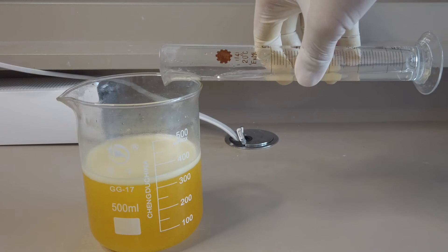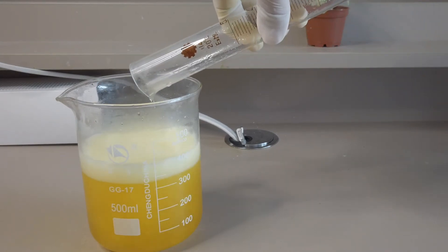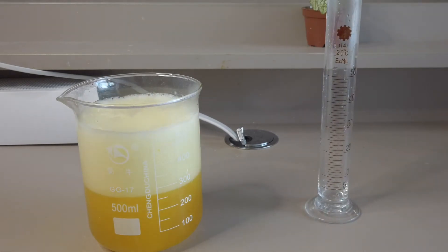To give it a foamy appearance we added in 15 milliliters of concentrated sulfuric acid. Immediately you can see some vigorous bubbling taking place as if a beer head was surfacing.